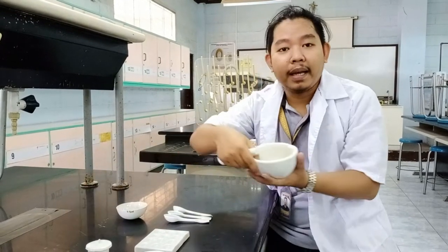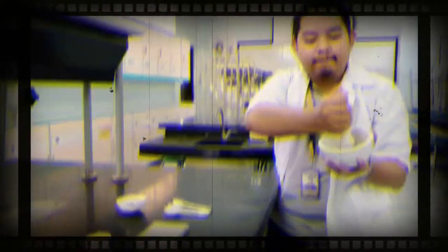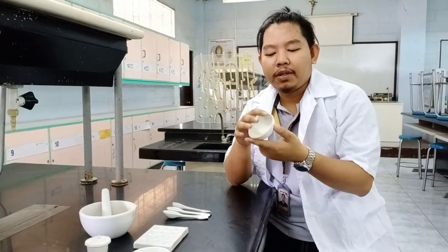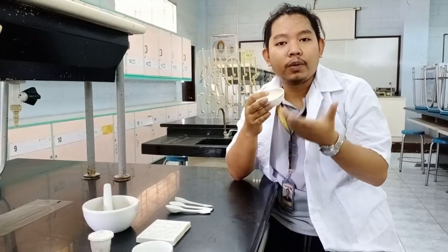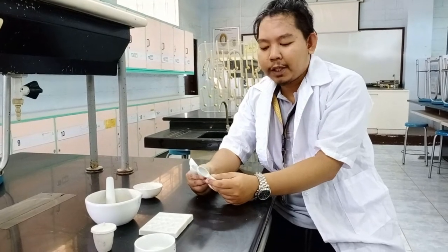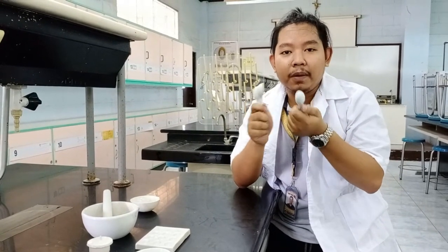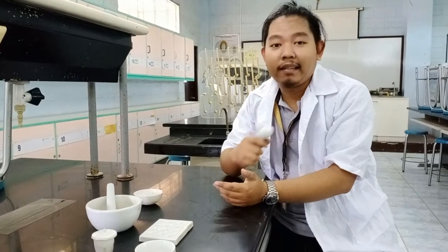We have the mortar and pestle. We use this to grind solids. And then we have the evaporating dish. Usually, we place here some liquid with a solid if we want to separate it, then place it on a tripod with a flame from an alcohol lamp. We also have ceramic spoons. To avoid contamination, we use glass or ceramic — not metal. So these are your ceramic and marble items.